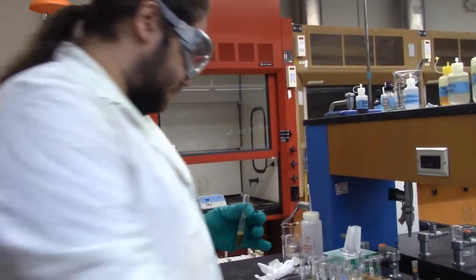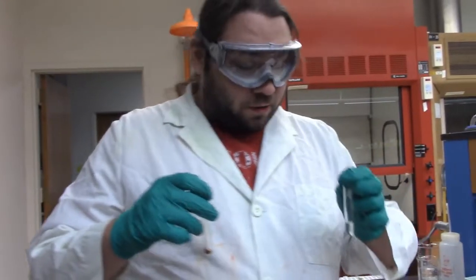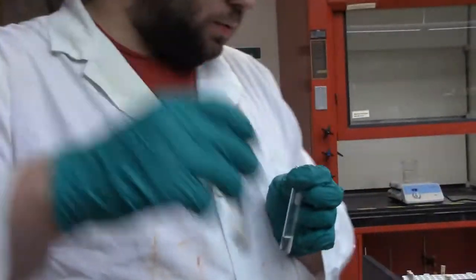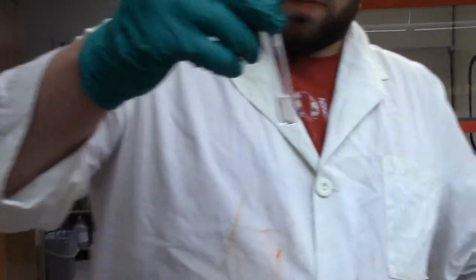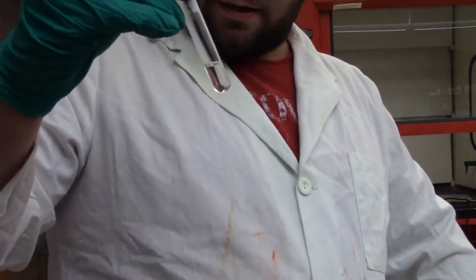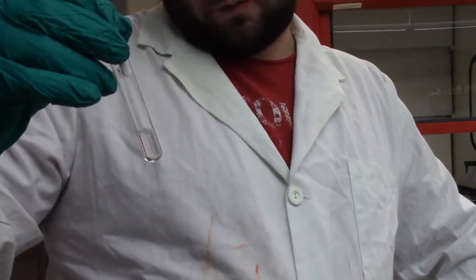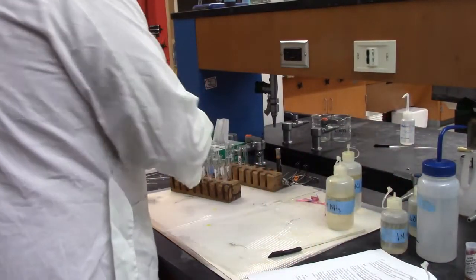Alright, so I've done step 5 on this part of our procedure, and here is our precipitate, which we're going to put away for the moment, and which we'll use to test for manganese and iron later. And here is our supernatant. Now, it never turned yellow, but like the instructions say, it is basic, and as the instructor here, I am saying we can just move forward. It says to ask your instructor. I'm the instructor.